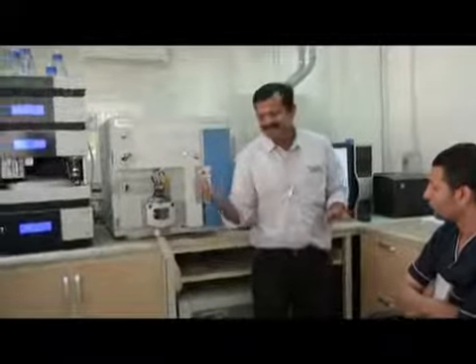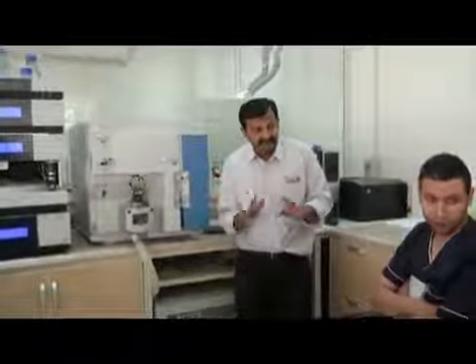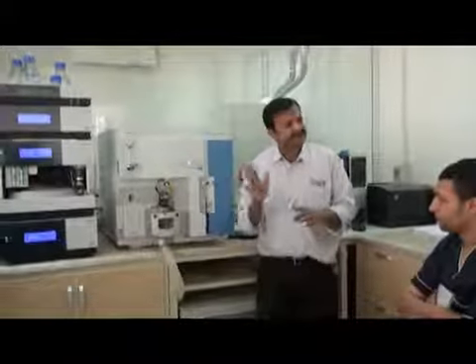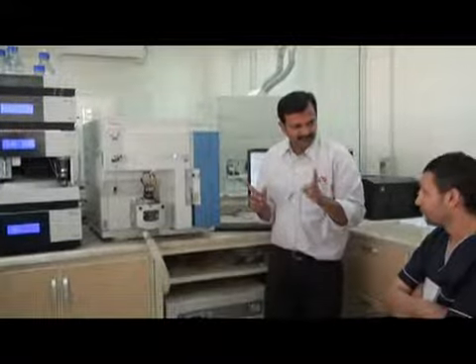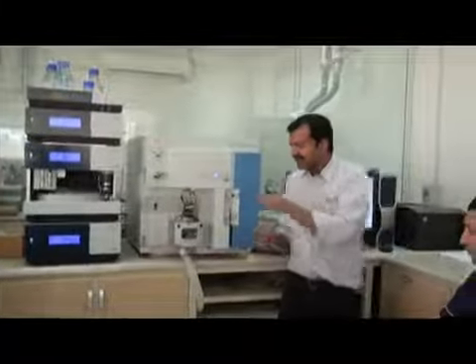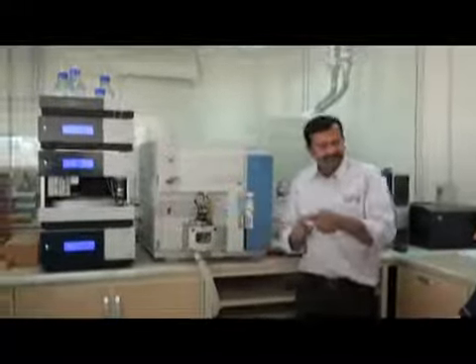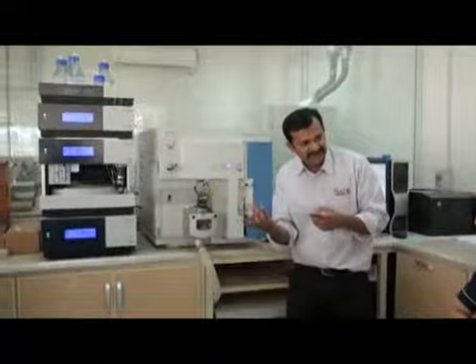And this is something like 4,000. 3,000, 4,000, 5,000, adjustable here. Very, very high voltage. This voltage makes your molecules ionize.